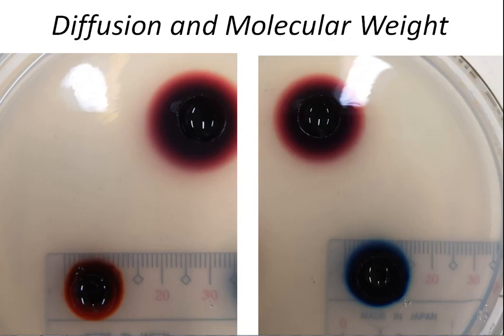This is a close-up of our agar plate after 30 minutes. Do you remember this hole contains your 1% Congo red, and we have placed the 0 mark of the ruler here, using the metric system.